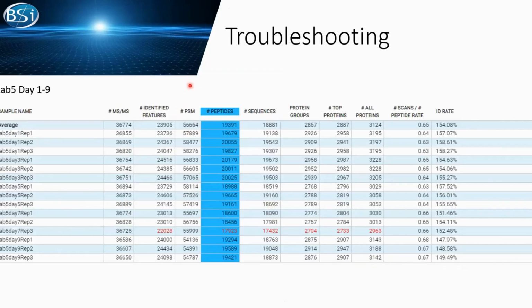So you see this sort of form before. We are taking out data from lab 5 from day 1 to day 9 and all their QC samples. You can see in lab 5 in day 7, replicate 3, we are seeing a series of low attributes. But I'm only seeing this once. If I'm doing this, I may wonder, is this a one-time thing or does something actually happen?